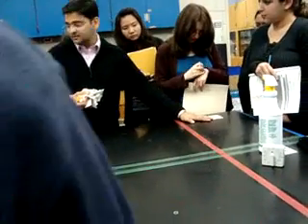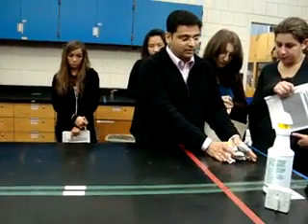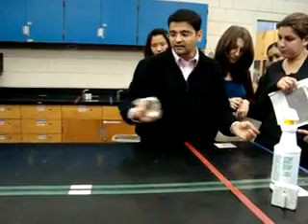This is the candidates exam paper area — the proper place. When you come here, you put your paper here. Everything goes over here. Then in one hand, you pick up everything and enter the hood.